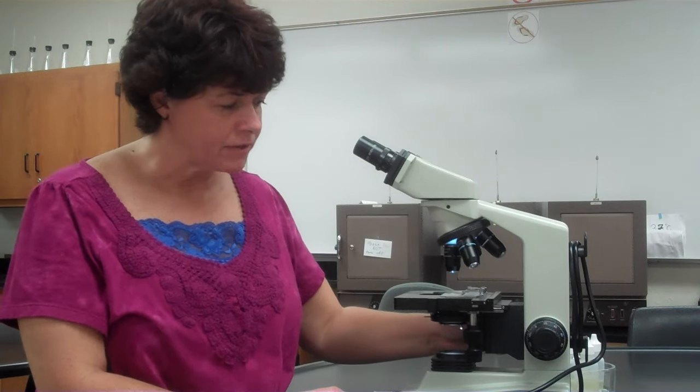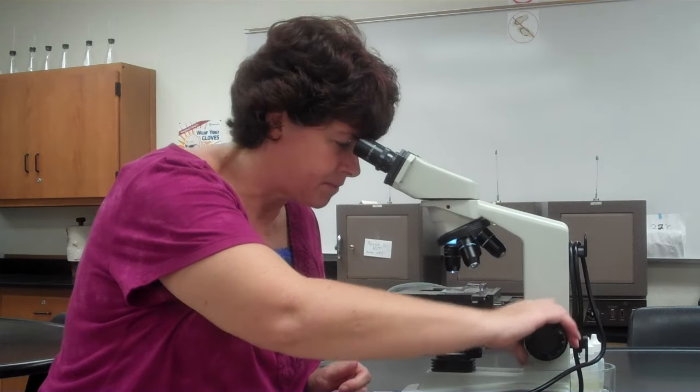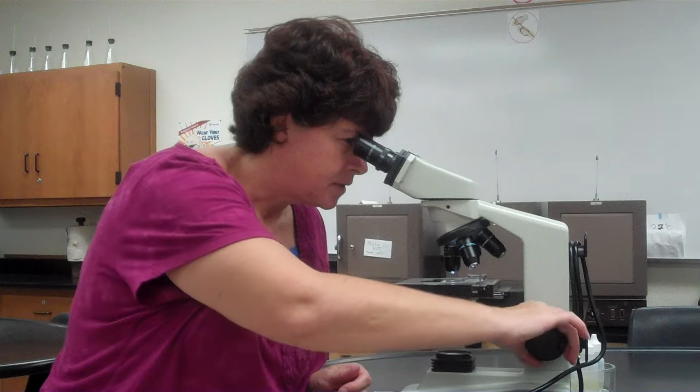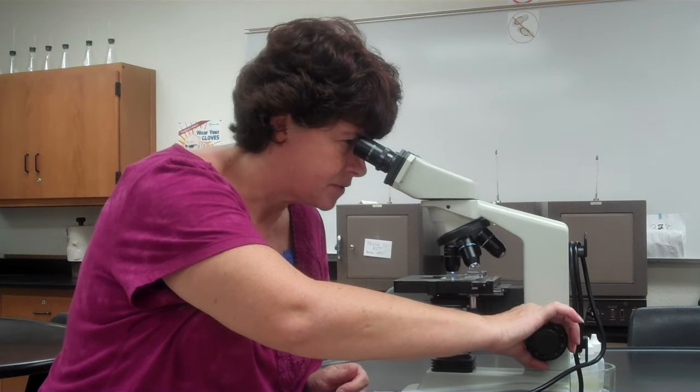Because we're dealing with very small bacteria, we do not need the 4x power — just skip that and always start with the 10x. You will have to find the organism and find the smear with the 10x power before you go any further. Use the coarse adjustment knob with the 10x to find your specimen.